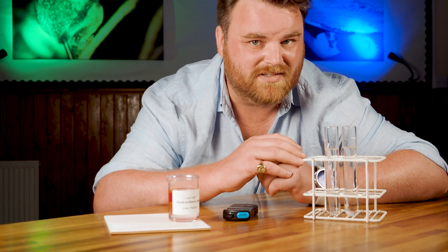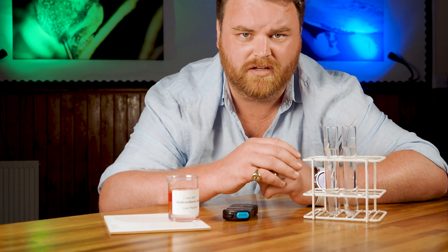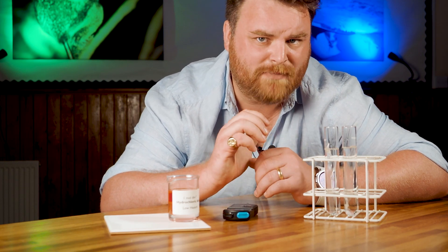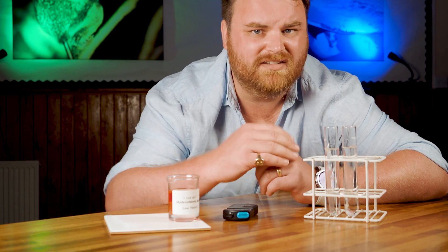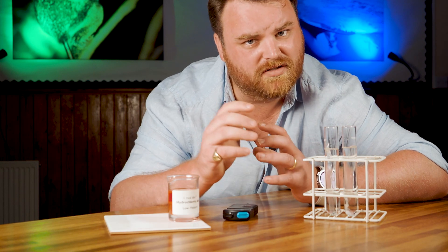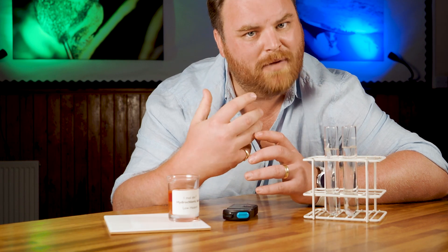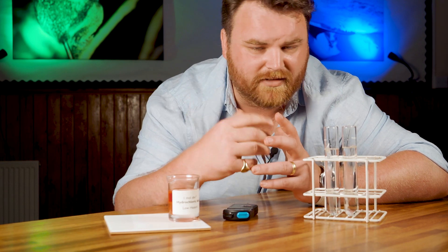Here we have a different setup. Each of the pouches in these boiling tubes is made of a material called visking tubing. This works like a cell membrane in that water can pass through it, but solutes can't. In each pouch is a 0.5 molar salt solution, and each boiling tube contains a different concentration of salt. Where the water potential is higher in the boiling tube, water moves into the pouch and it'll gain mass. Where it's higher in the pouch, it'll move out. And where it's the same, it'll stay the same.